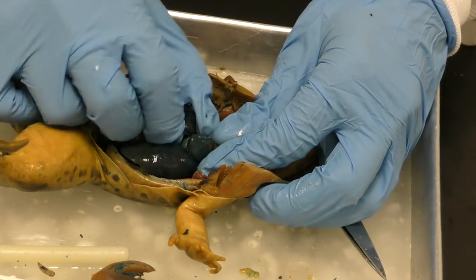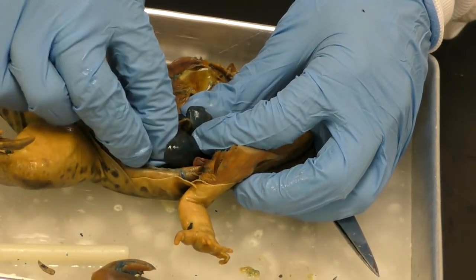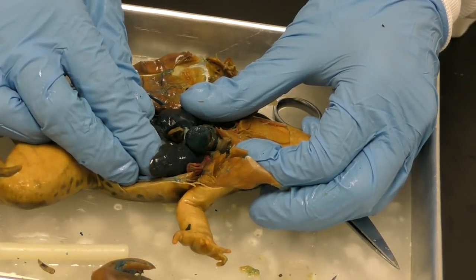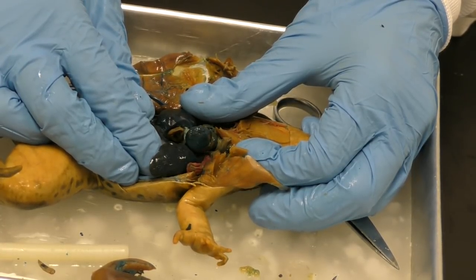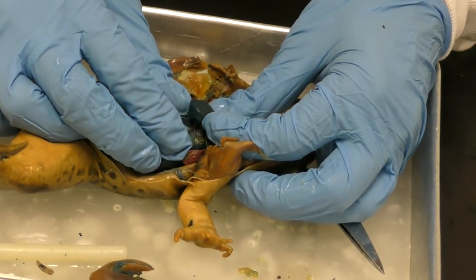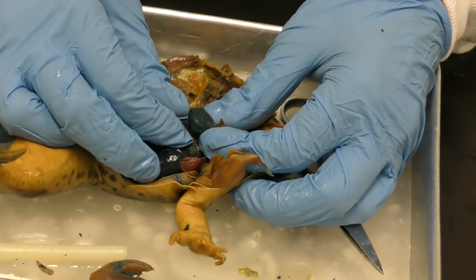Okay, we refer to the liver as part of the excretory system because it kind of works with filtration from digestive and urinary. So it works for both. So like drinking and eating.